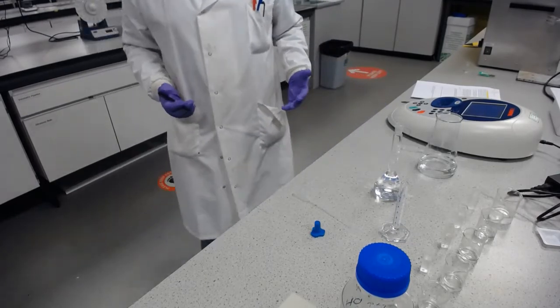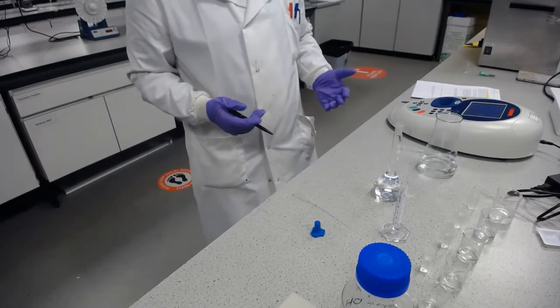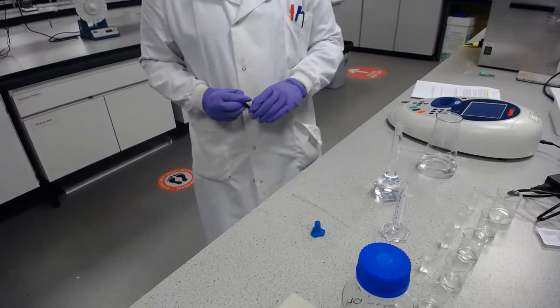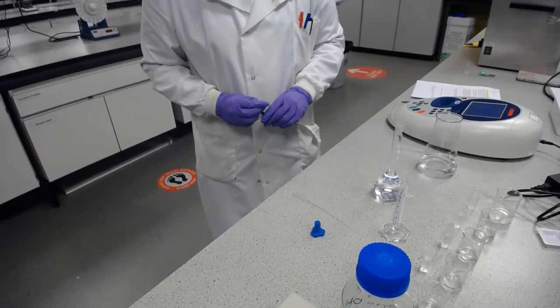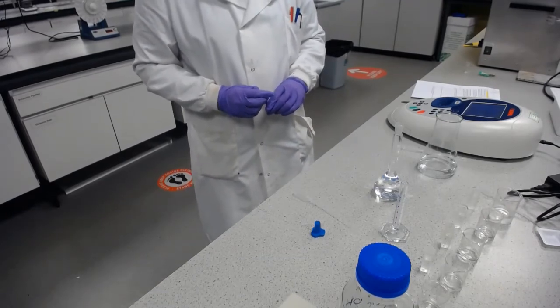The next part is going to be done outside of the lab. We're going to take the results, which I'll share with you, to do the calibration, and then we'll be able to determine the concentration in the aqueous layer of that partition coefficient experiment, and then do a little bit more analysis and thinking after that.